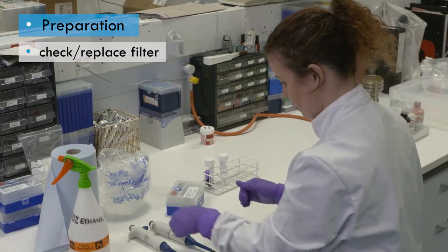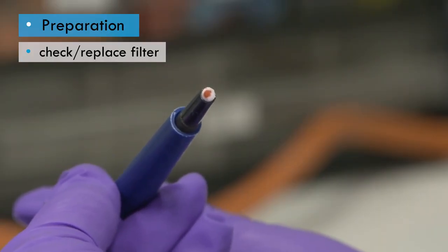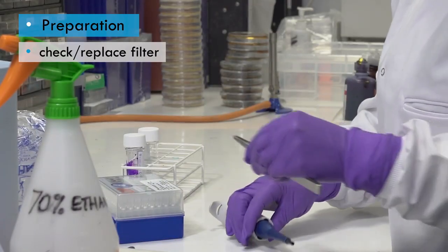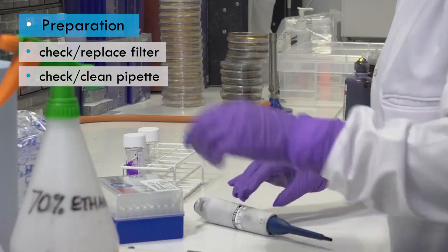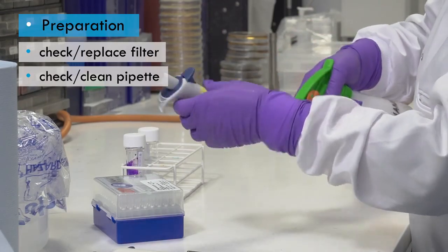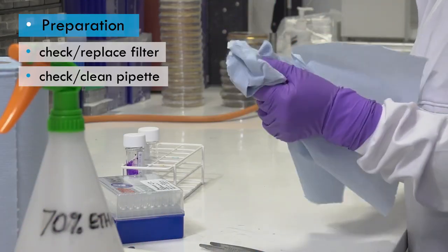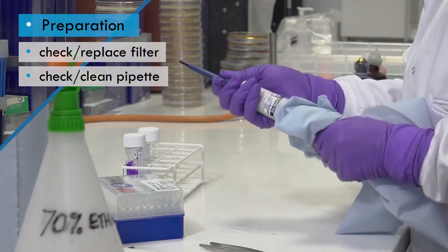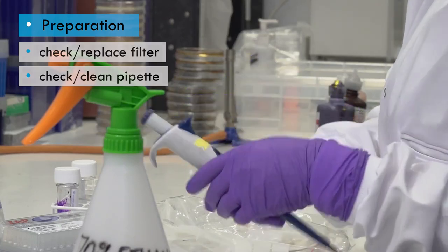If the pipette has a filter, it should be checked for contamination and replaced if necessary. The pipette surface should be checked for contamination, and if necessary, it should be cleaned by wiping it with the disinfectant. If the pipette becomes contaminated during use, you'll need to carry out these checks and procedures again, or switch to a spare pipette and decontaminate the original one when the work is finished.